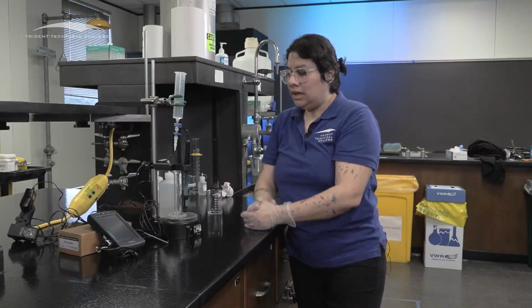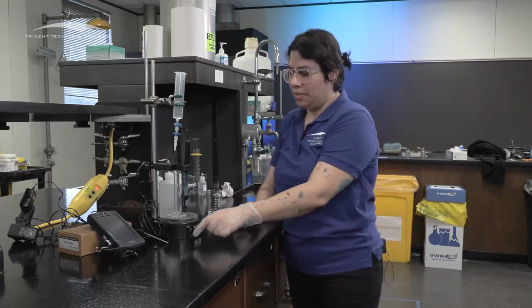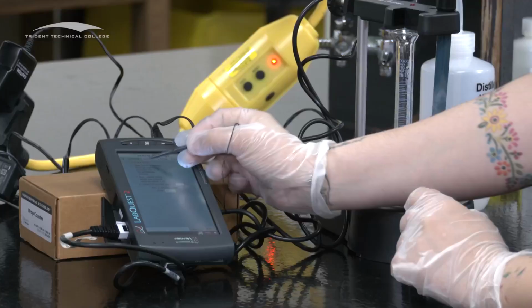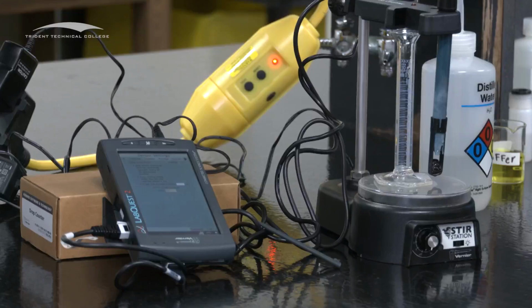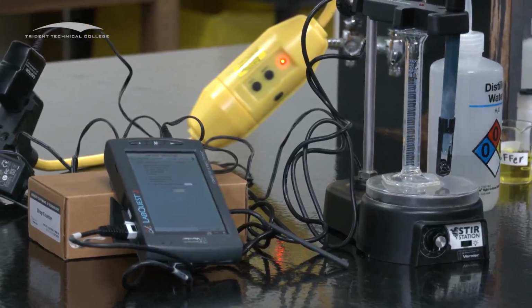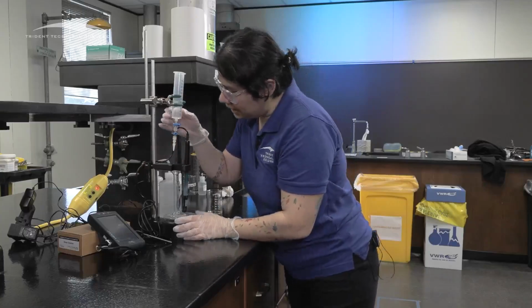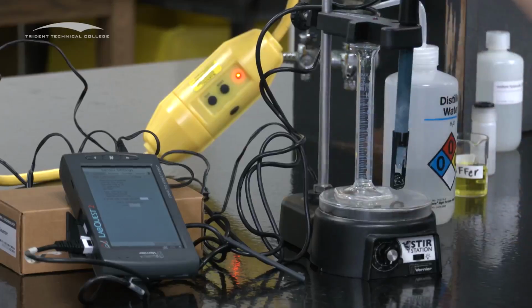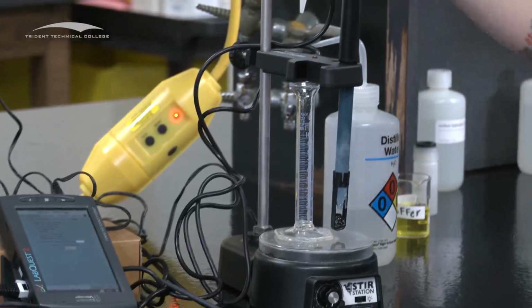So to do this, I'm going to hit calibrate now first before I drop anything. So I'm going to go in, calibrate now. And then if you see it reads as 0 drops, then make sure that it is right underneath it. And if you're not sure, you can start with a beaker.